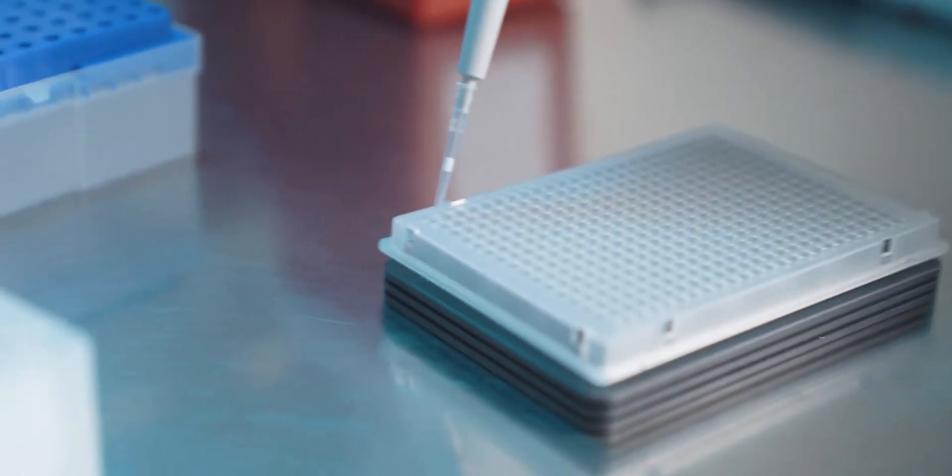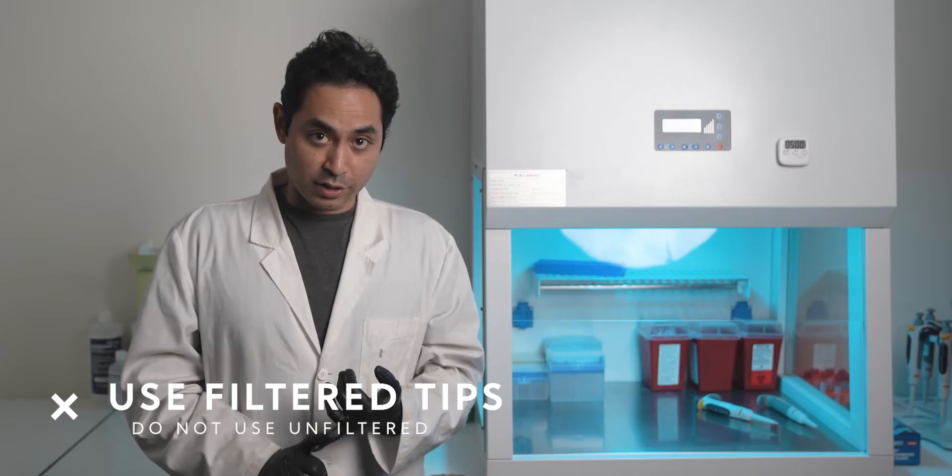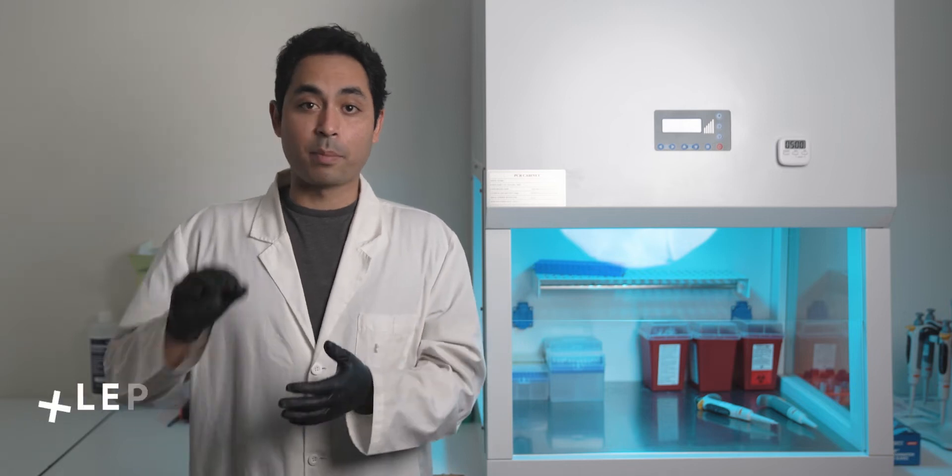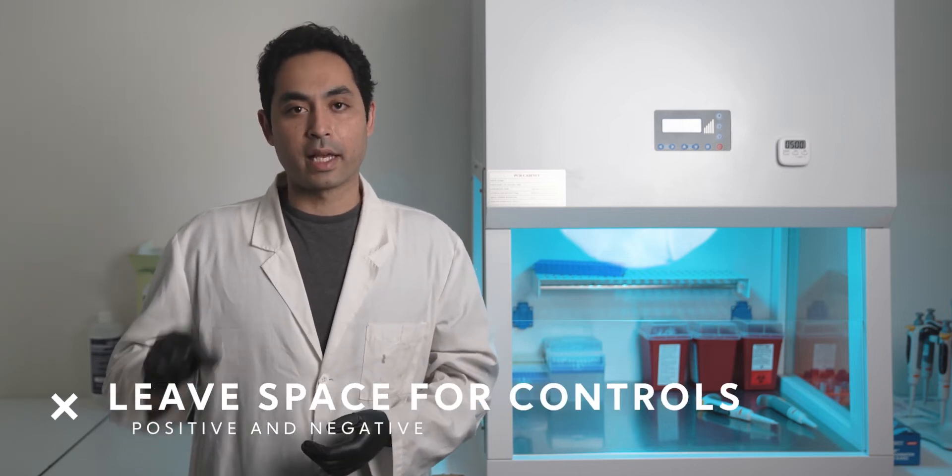After the master mix is in the plate, you can add your sample. Do not reuse tips at this point. Make sure you use filter tips. Do not forget to leave some spots on your plate for your positive and negative controls.